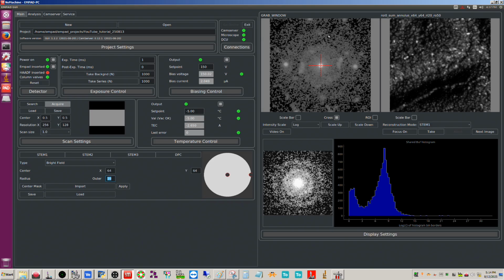pixels, because our DP is 128 by 128. So you can see, that's 30. So that would be right about the radius is about half of the half width of the DP, if you will. Let's see if we do dark field. Okay, so this actually goes all the way to the edge now. So your outer radius, actually there isn't one, so to speak. It goes all the way to the corners, and then you just have an inner angle here that you can adjust. Will it let me modify this anymore?